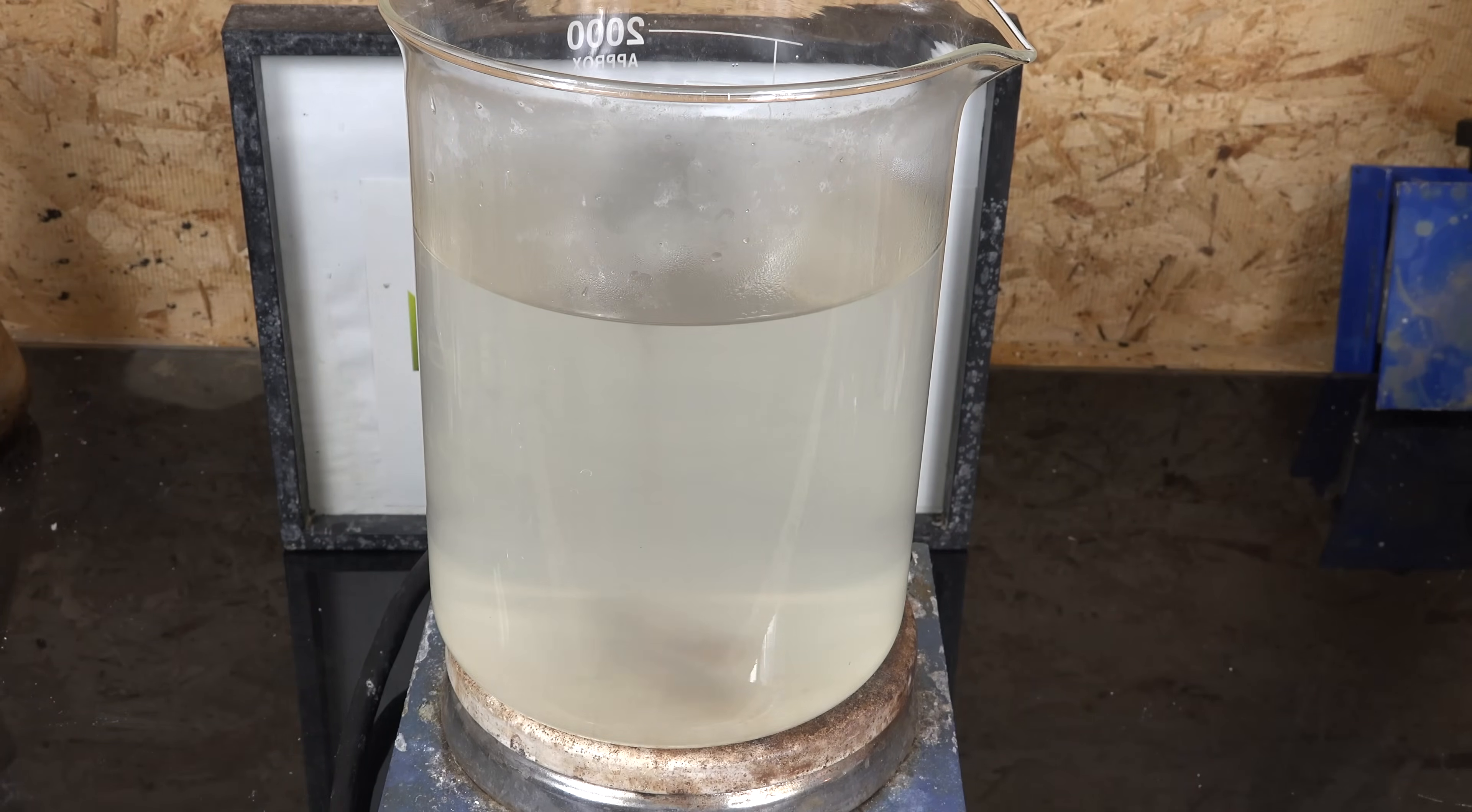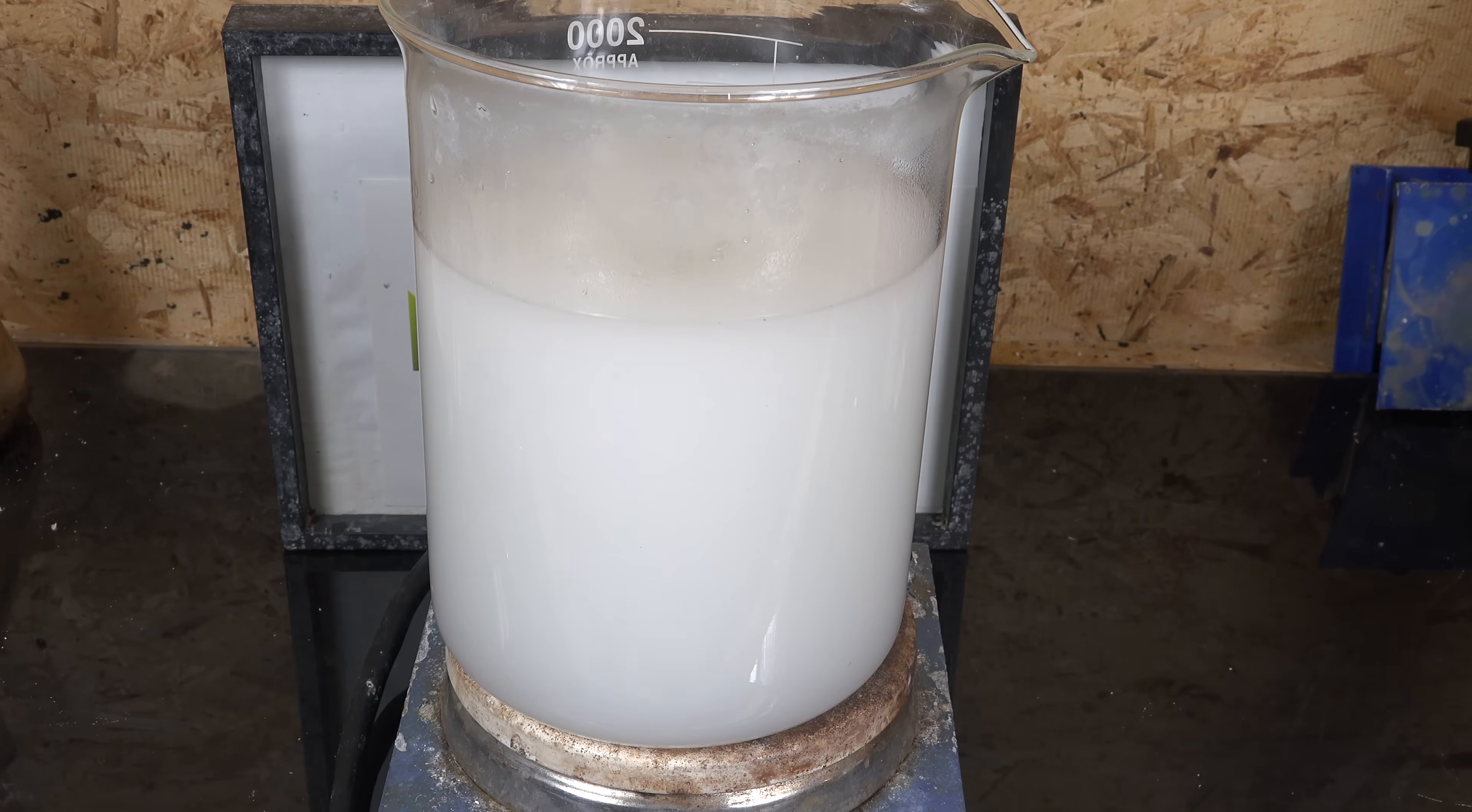It seems this process failed because the magnesium oxide formed just wasn't stable enough to drive the reaction forward. So the sulfuric acid produced simply reacted with the magnesium oxide and drove it back again.